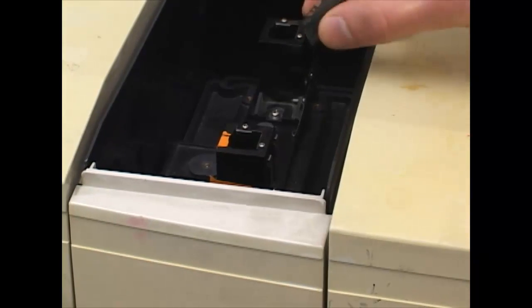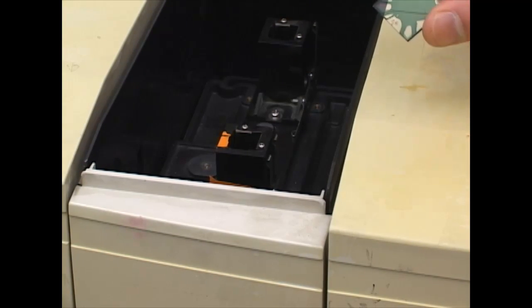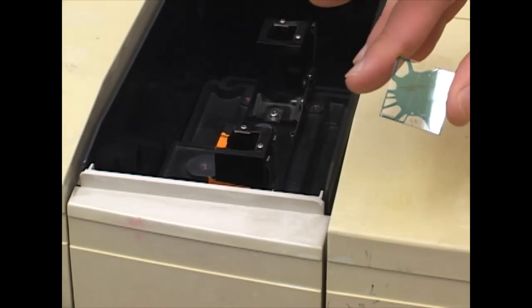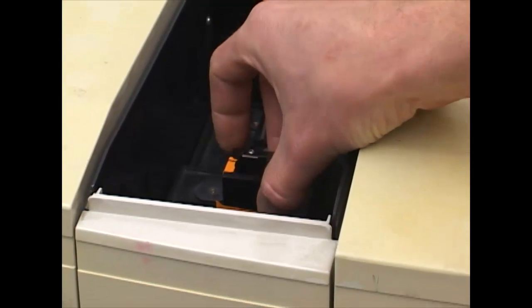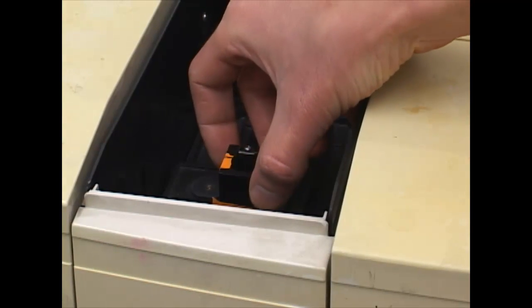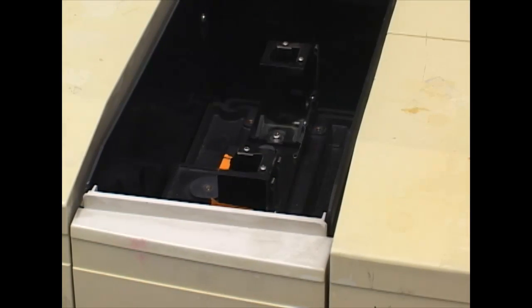I took the blank sample out. Now I am going to put the actual sample. It's important to make sure that the material on the slide is in the way of the light beam, so it measures the compound and not just empty glass.